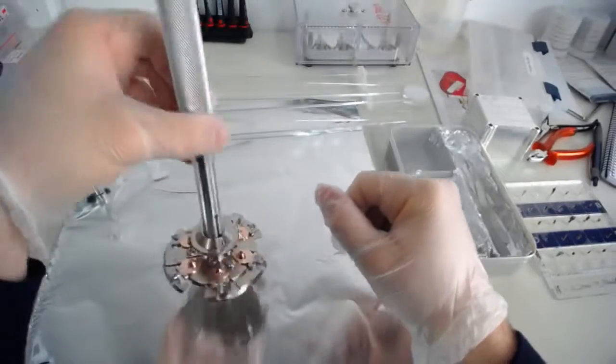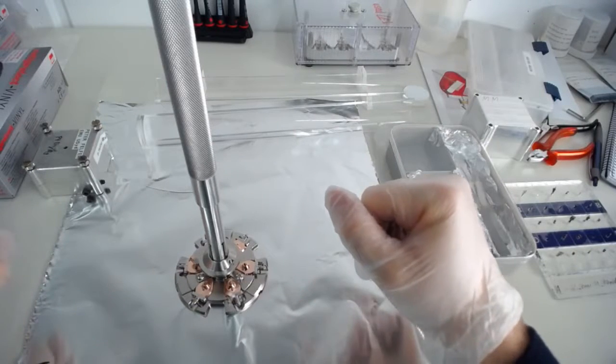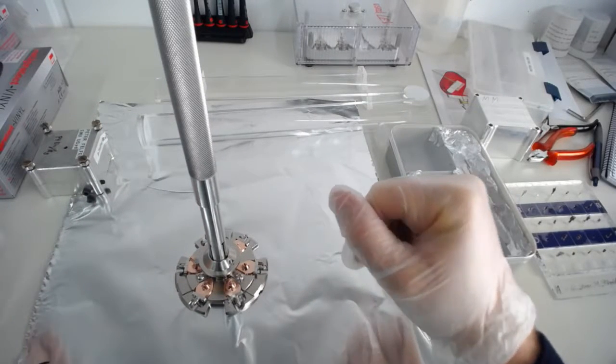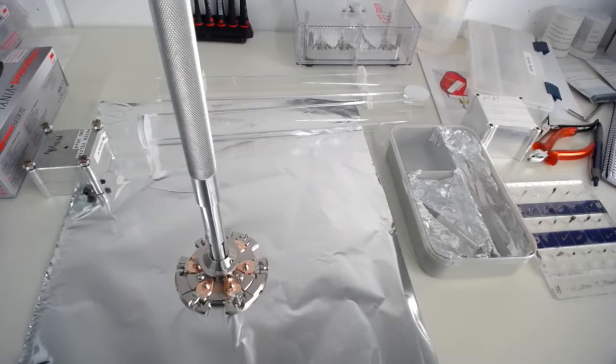Okay, so now we've got the sample in, we've really worked in a nice and clean environment, and this is a good start for an atom probe experiment. And as soon as I've got my video capture card, we'll carry on with the work we do, putting the sample into the atom probe, and then we'll go through the user interface and what the different bits in the user interface do, and which buttons you need to press to put your samples into the leap, and then later on how to do experiments using voltage atom probe and laser atom probe mode. All right, so that's it for now, and we'll continue once we're set up.